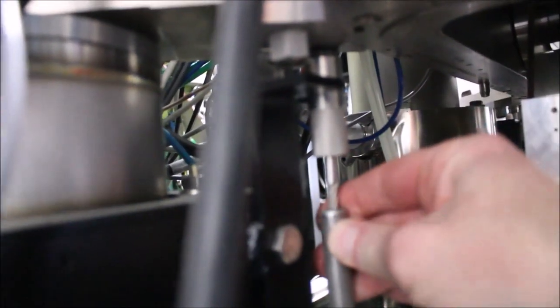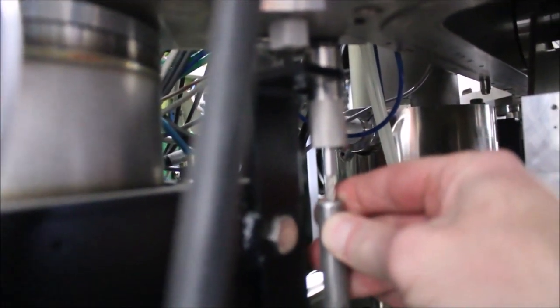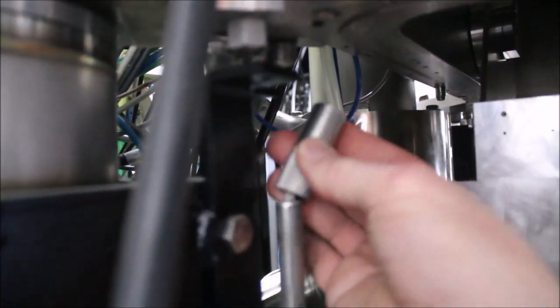Now that the sump is down and the weight is on the cart, we have to loosen each one of these four little cable nuts. We've got to make sure that these cables are completely slack. Remove the nut and do this on each corner.